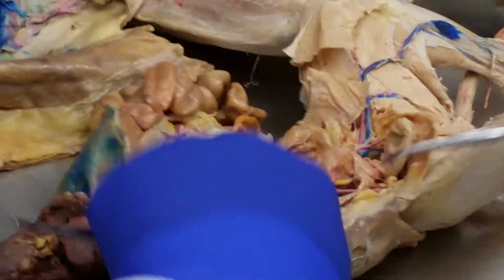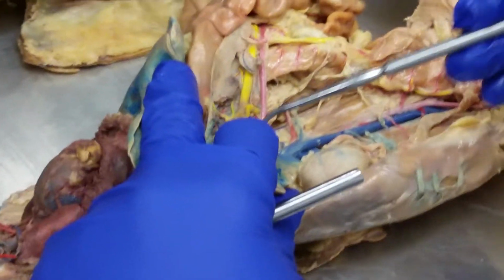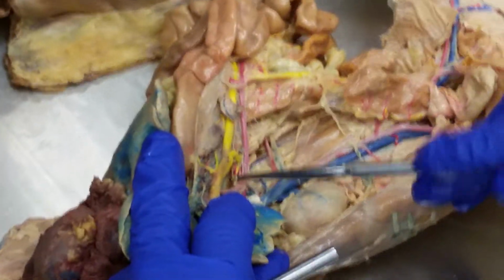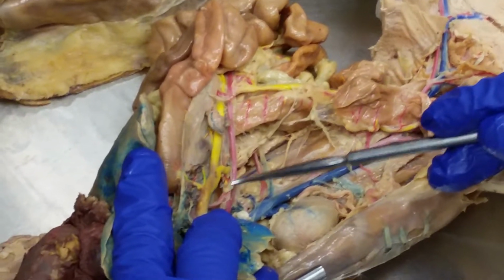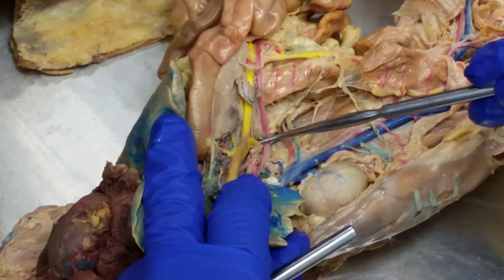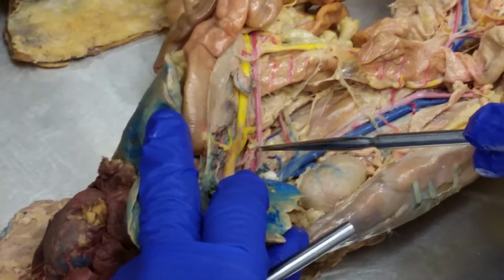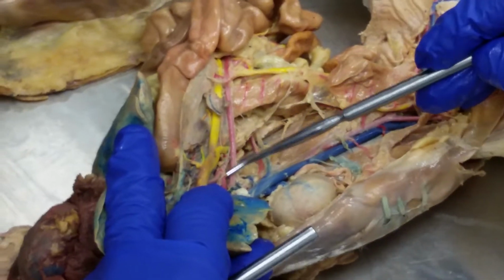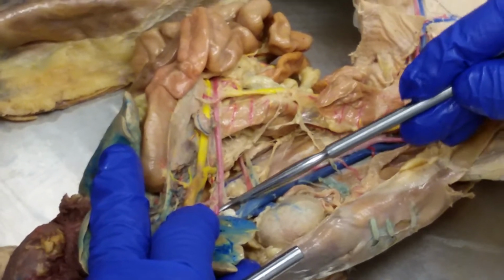This one has got a better view of that celiac trunk. This one, it's just one of them didn't get very infused. So anyway, so celiac trunk, okay, and it splits into this hepatic artery, and then this one in the middle here that didn't get quite so infused is the gastric artery, and then this one here, which got well infused, will be the splenic artery. So it's the hepatic, gastric, and splenic, arteries coming from the celiac trunk. That's why it's called a trunk.